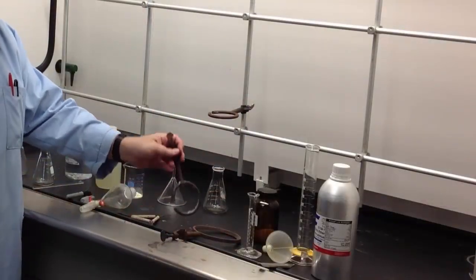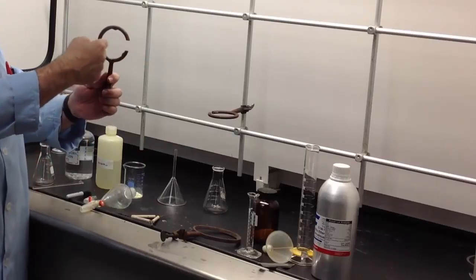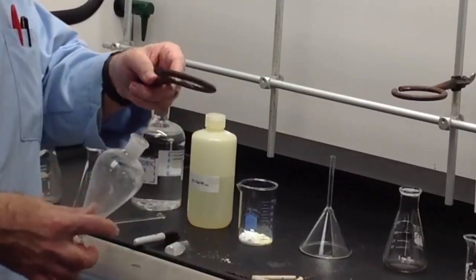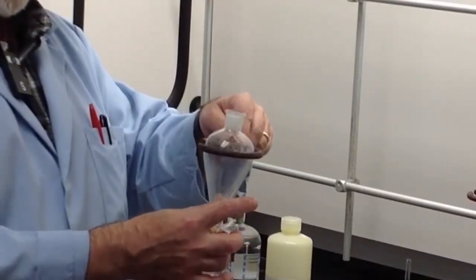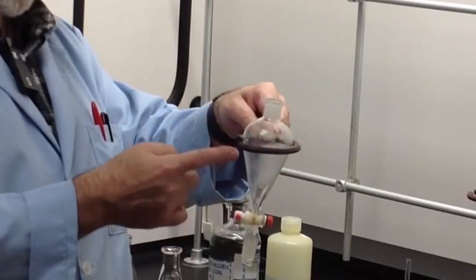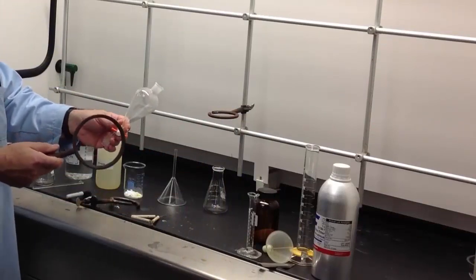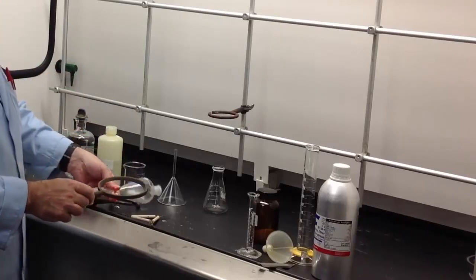When it comes to the ring clamp, check the ring clamp. Now, this one in particular does have a cut on this side. That just makes it a little bit easier getting the separatory funnel in and out of the clamp. What you want to make sure, though, is that the ring clamp is of such a size that the separatory funnel cannot pass through. This allows the separatory funnel to be placed in the clamp and the liquids inside then to come to equilibrium. Some of you will have a ring that is clearly too large for the separatory funnel, so that it just passes right through.